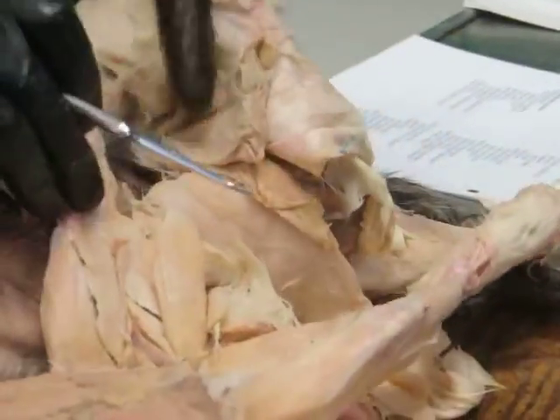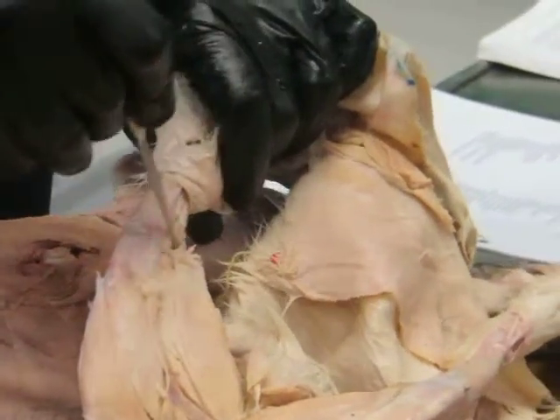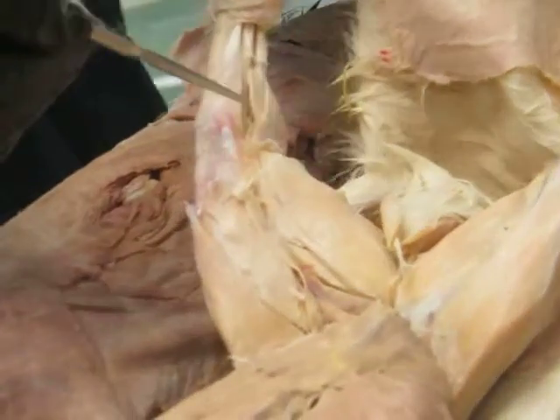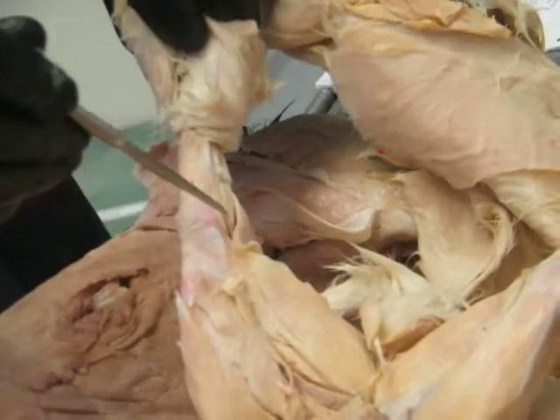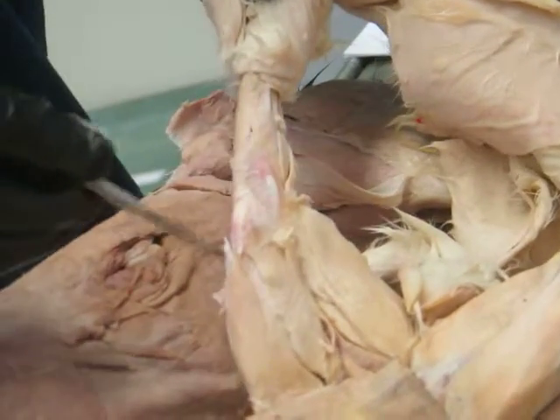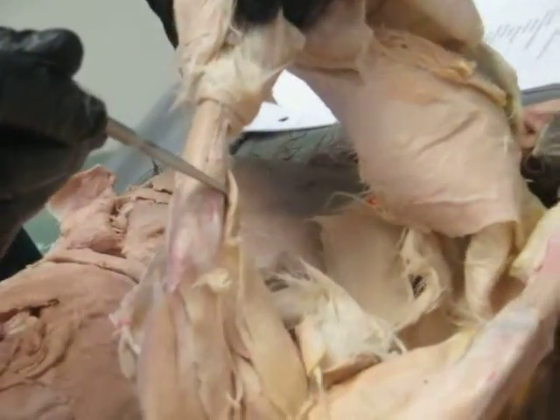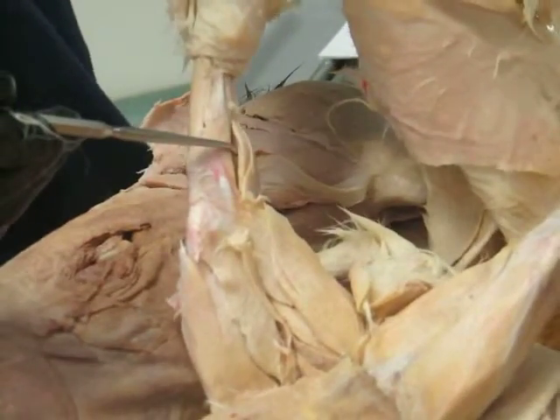And then on the back side of the shank, there's a muscle called the gastrocnemius. We saw it already in a frog. It's this guy right here. And that arises by two heads from the distal femur. It joins with another muscle that's deep to it right here. That's called the soleus, because it looks like a flat fish, like a sole in a human.